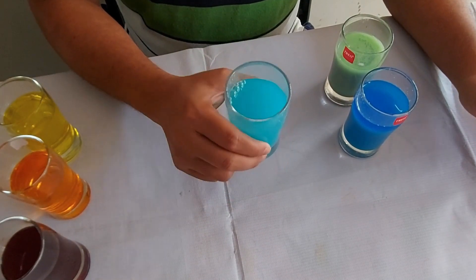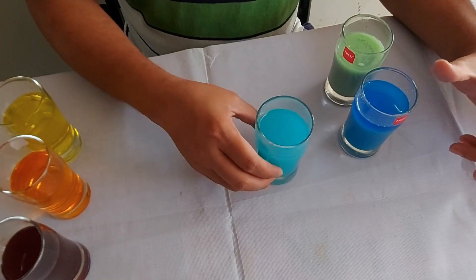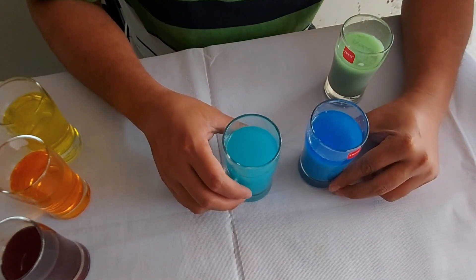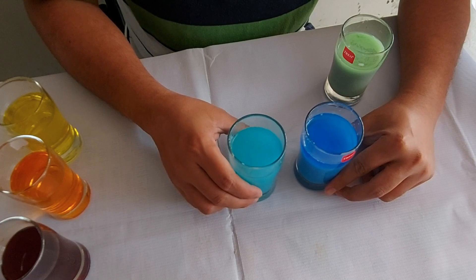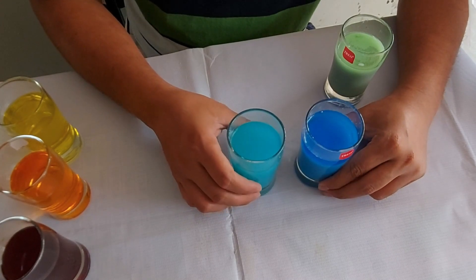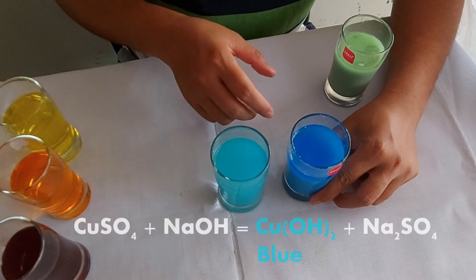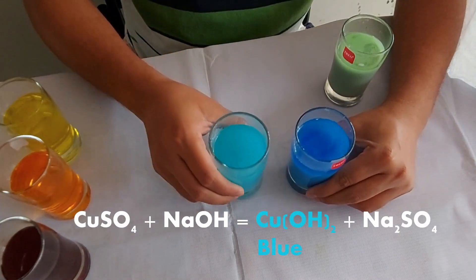Now we have already done the blue color. Basically this is the indigo color and this is the blue color, which are nearly somewhat similar, but we should not confuse between these two colors. These two are very different. See, this is the indigo color and this is the blue color.